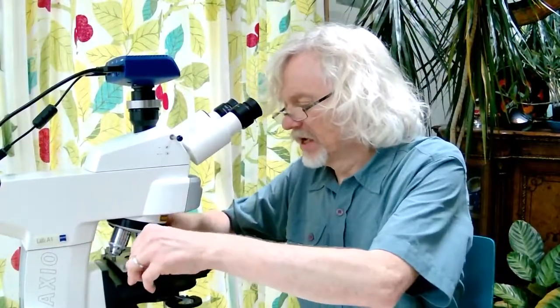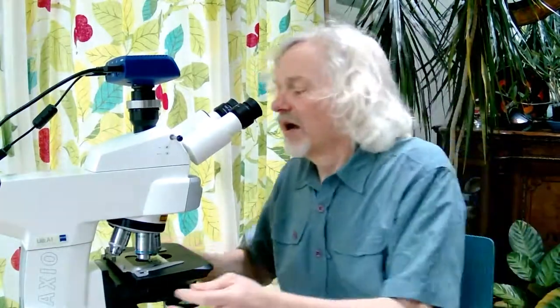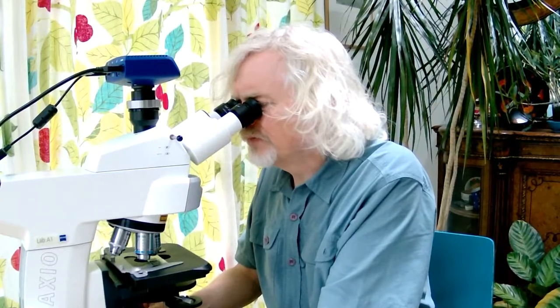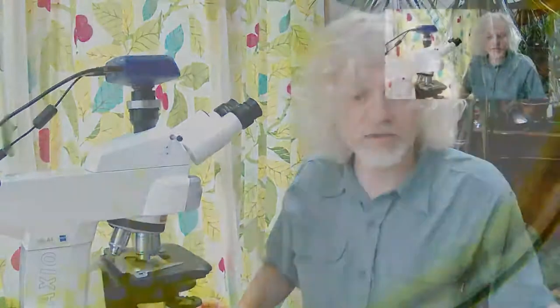So let's take a look under the microscope and see what we can see. So once I'm doing that, I'm just going to go back to this. I'm going to pop it under there and then find it. Okay, good. I have, yep, you've always got to worry, have I sliced it thin enough? So, okay, let's zoom to the microscope itself.